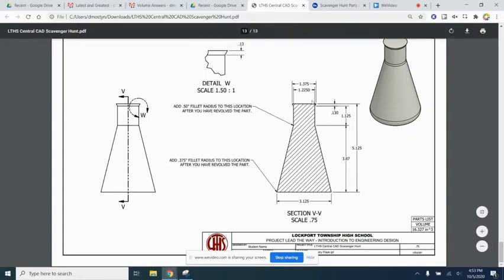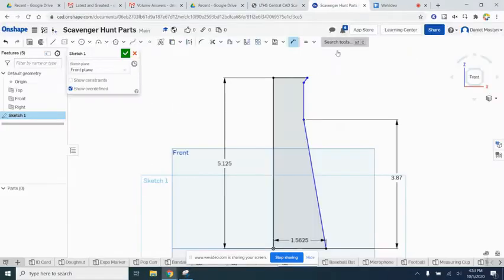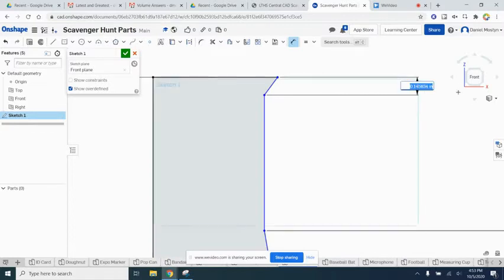We could also do this one right here. You see this little lip here? From this corner right here to right down here, the vertical distance is 0.13. Let's throw that in there before it gets too tiny. Ooh, that's a little dimension. It's a little touchy. Let's zoom in. There we go. That's pretty close. It's 0.14 right now, so let's put 0.13. That's good.